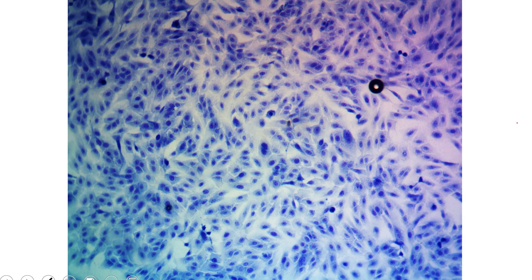And finally, I believe this is the last slide. Here is one from a happy culture of HepaRG cells. And you can see this is a very confluent culture. This is definitely out of log phase of growth. So these cells have been growing happily, replicating, dividing. And you see very few areas that are empty. Almost negligible areas. You see a little bit here, and this little blob here. But overall, the entire surface is essentially covered. So this would be a 95+% confluence. Probably I would even go up to 97, 98%. So anything 95 or above would be considered appropriate for this one.